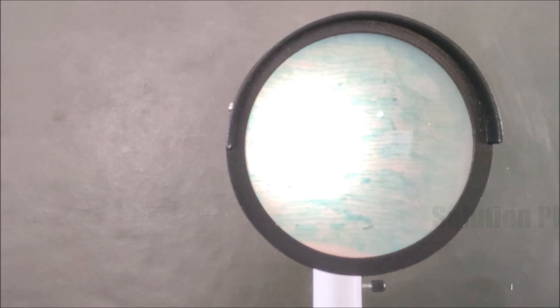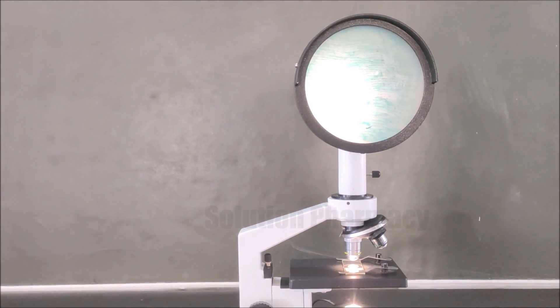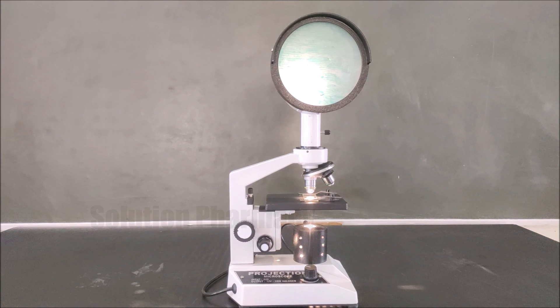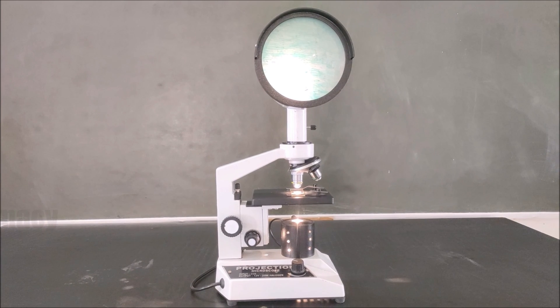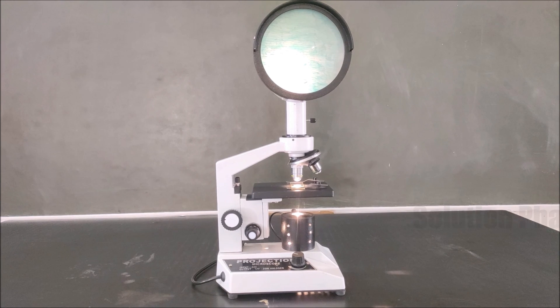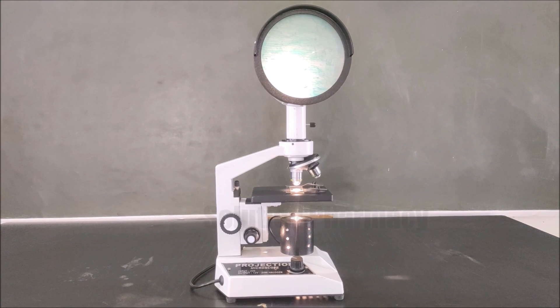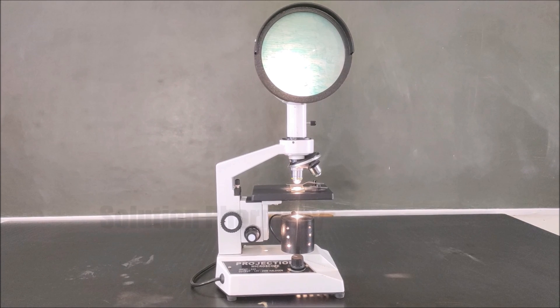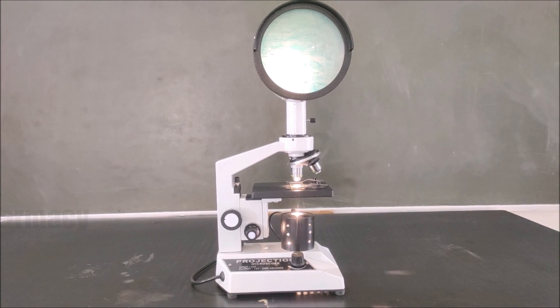Now you can see the onion tissue on the screen in focus. This type of projection microscope is very useful for educational purposes because a normal compound light microscope allows only one person to observe a specimen at a time through the eyepiece. With a projection microscope, multiple students can observe the magnified image at once since the image projects on the screen, which can also be rotated 360 degrees. It is also very useful for teaching, where a teacher can show slides of plant tissue, animal tissue, or microbes and explain each part of the magnified image.